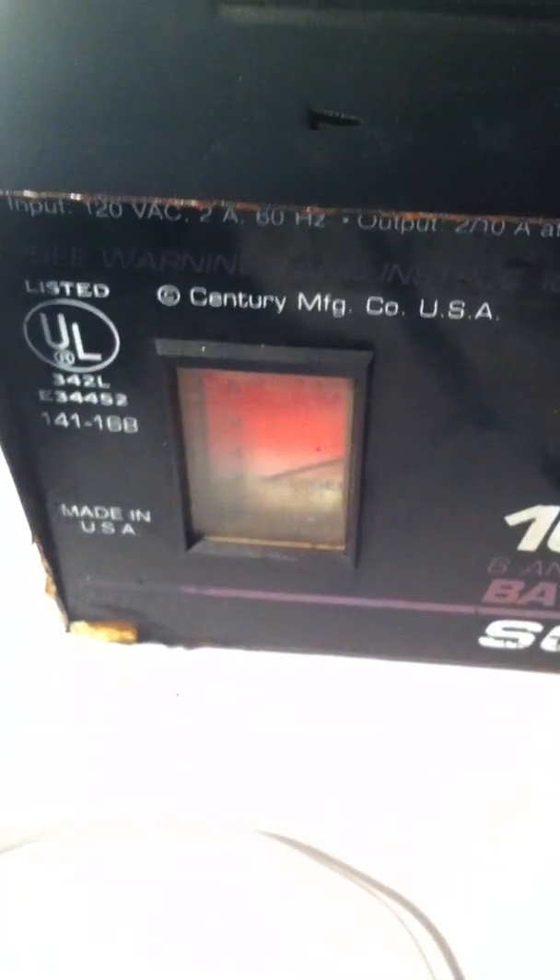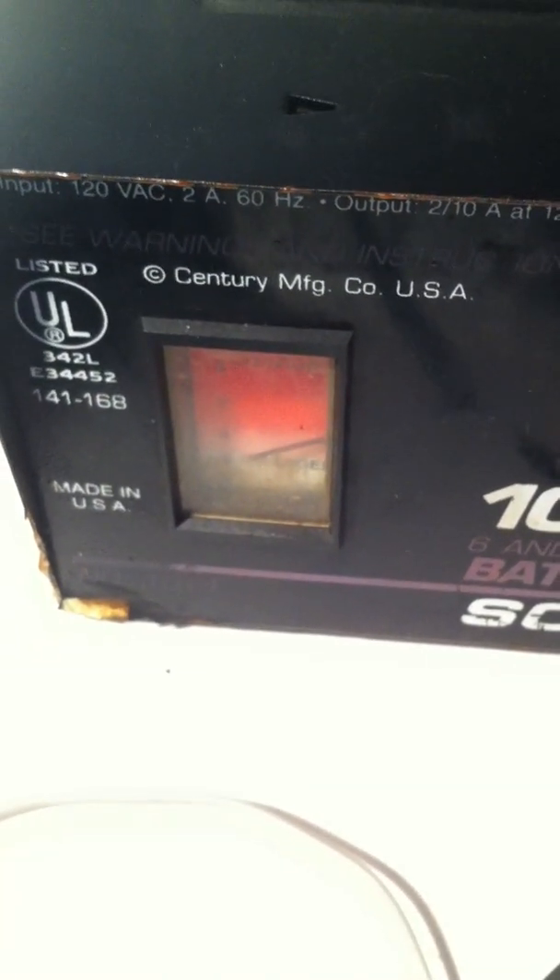We can see that there are about 4 minutes. We're down to just about 0 amps, so there's not much left going on. There's a little bit of bubbles still going on, but you can see it's cleared as far as bubbles. And you can definitely see the change in the color in the acid itself.